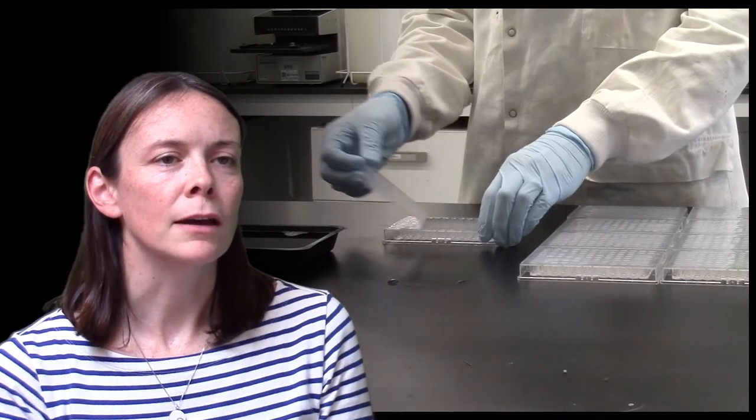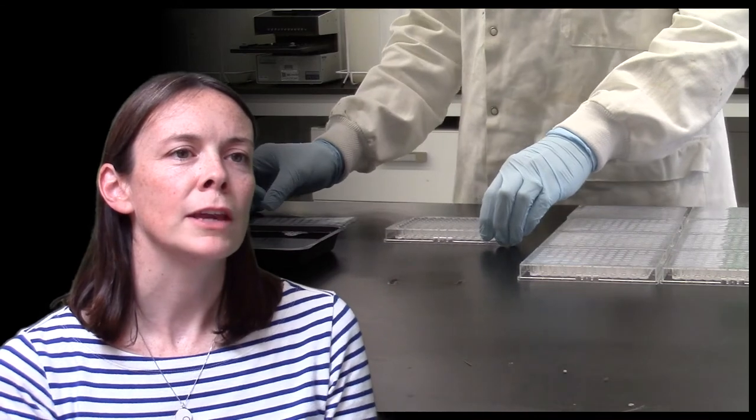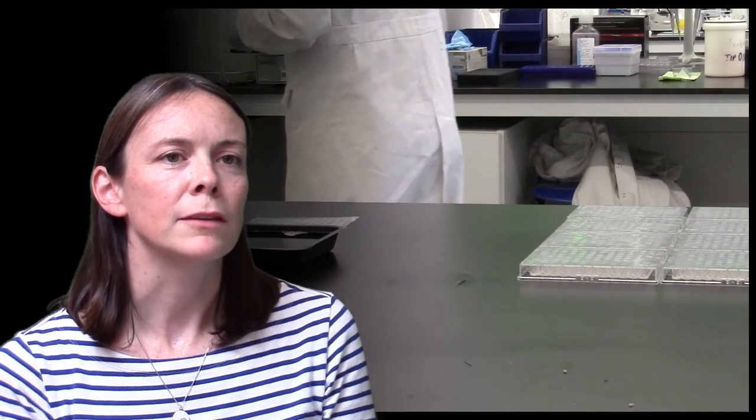In the ELISA shown here, I am detecting antibodies to the HIV envelope protein from guinea pigs that have been immunised with an experimental vaccine candidate.